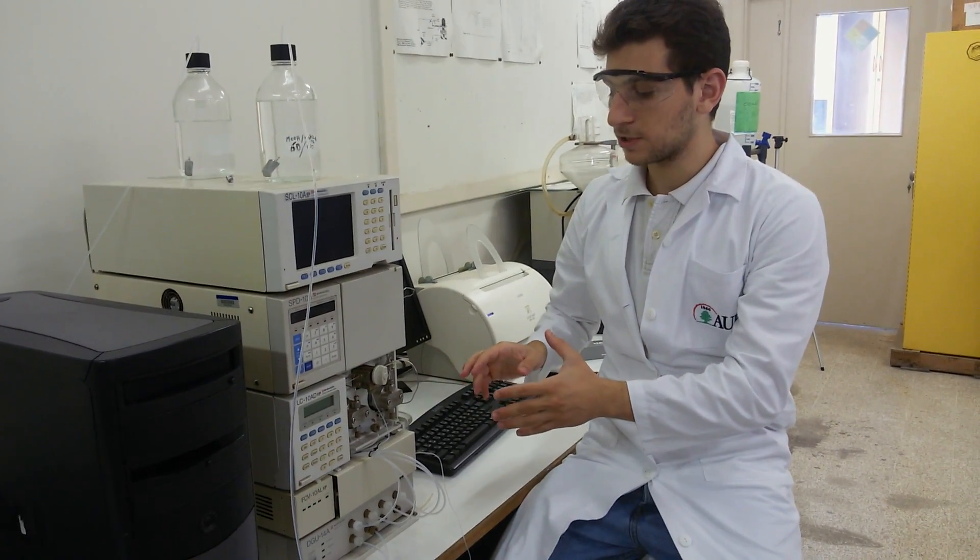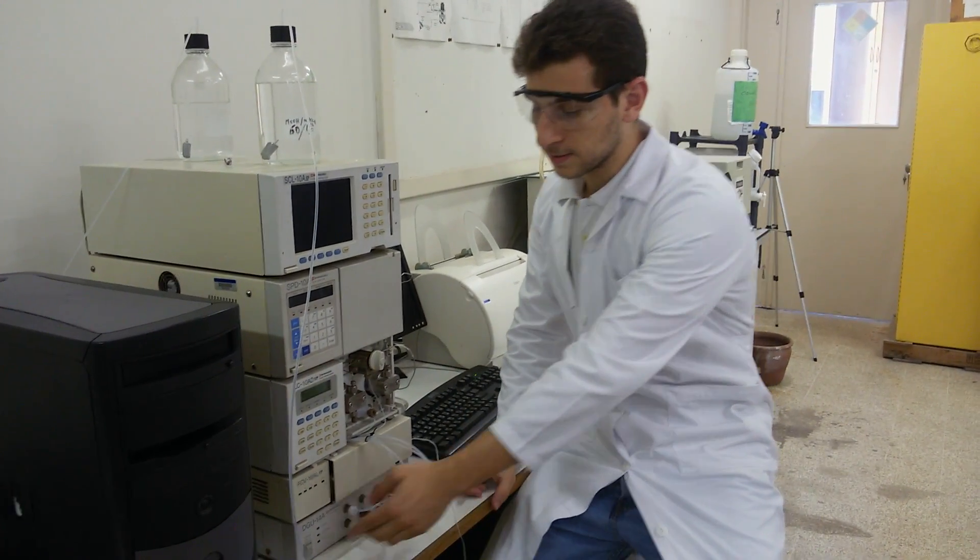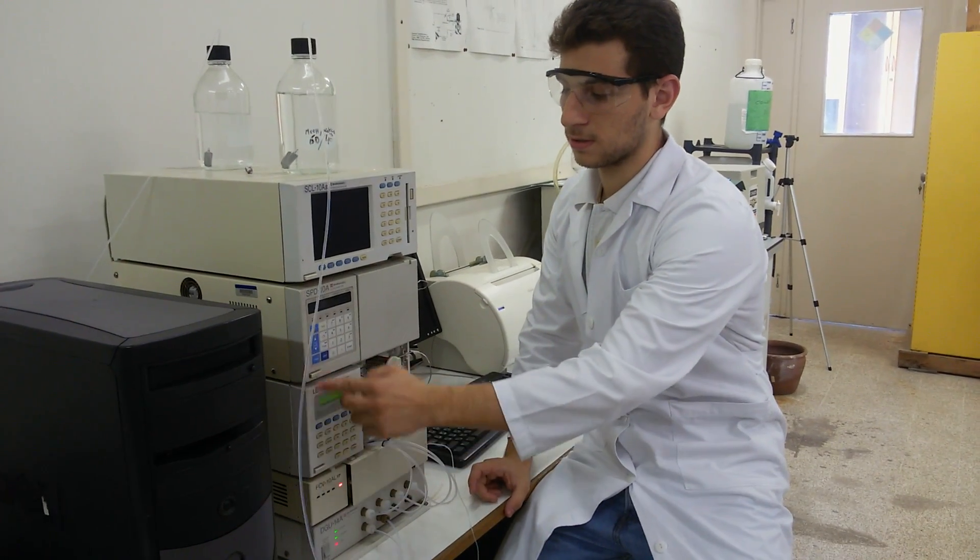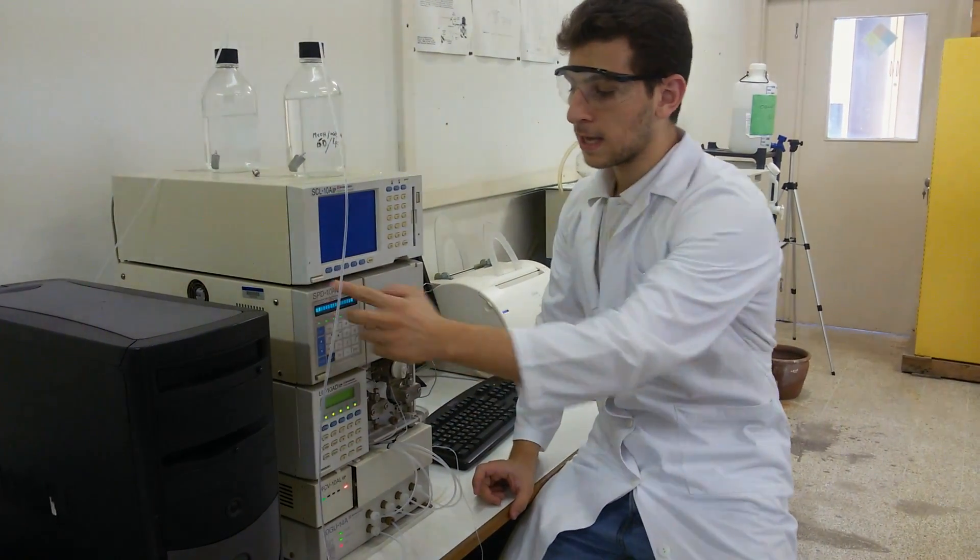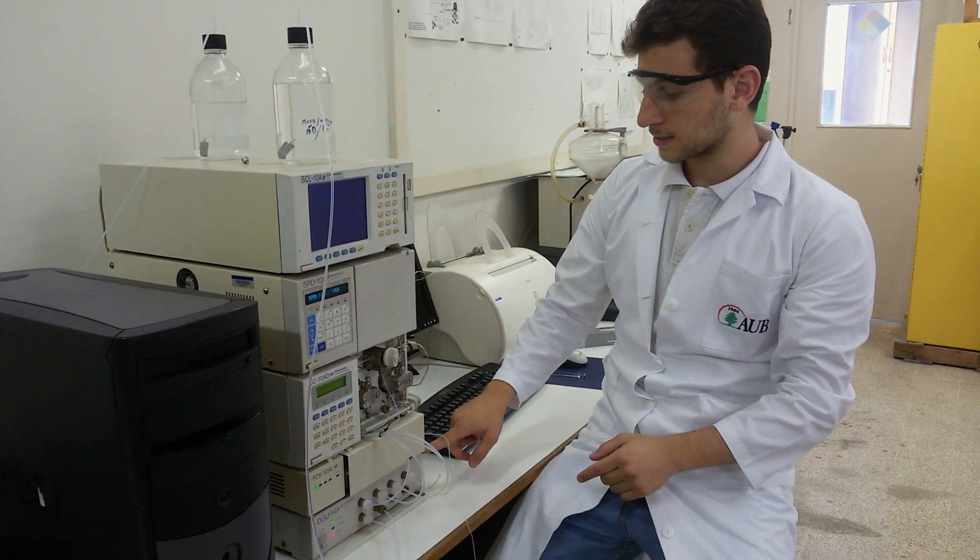This is the HPLC machine. First of all, we need to start it from bottom to top like that. It is composed of four modules.